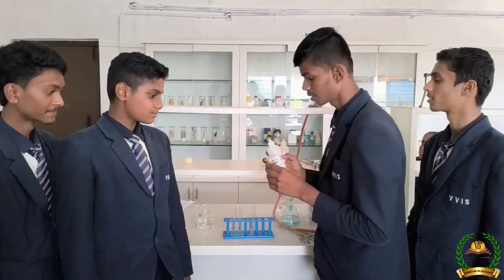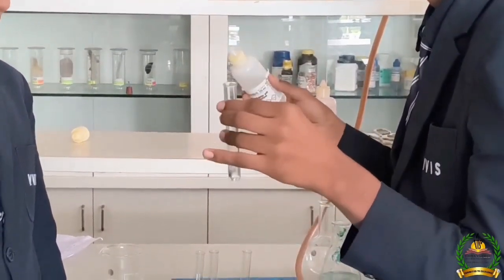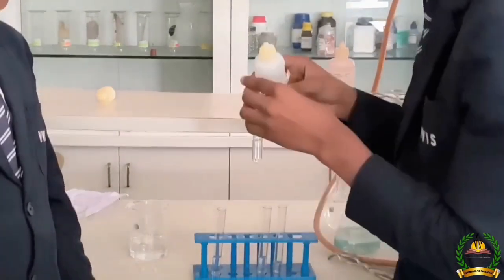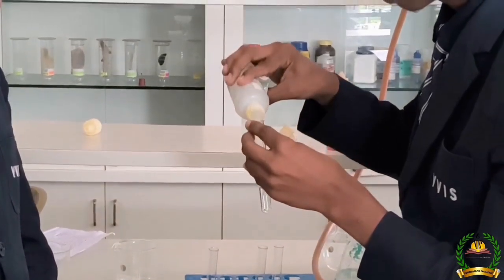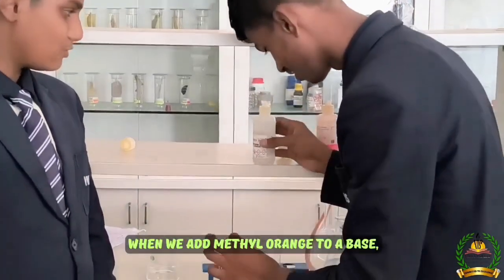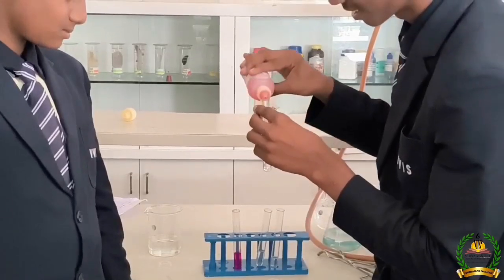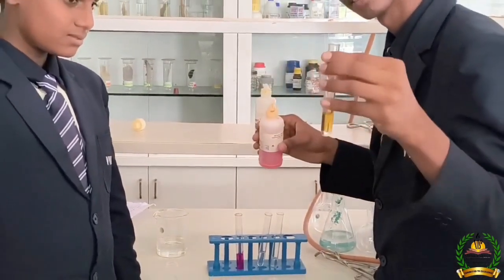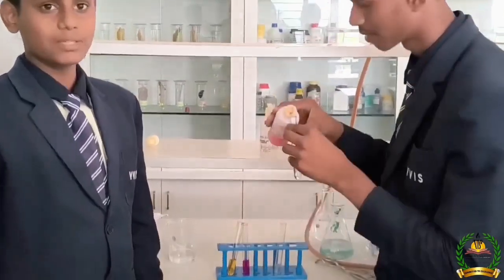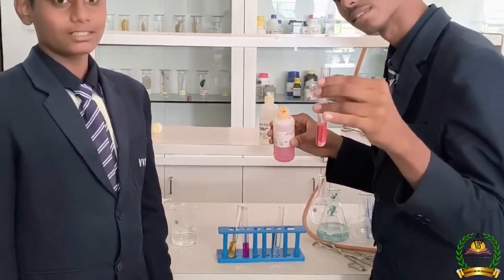When we add phenolphthalein to acid, it remains colorless. When we add phenolphthalein to base, it turns pink. When we add methyl orange to base, it turns yellow. When we add methyl orange to acid, it turns pink.